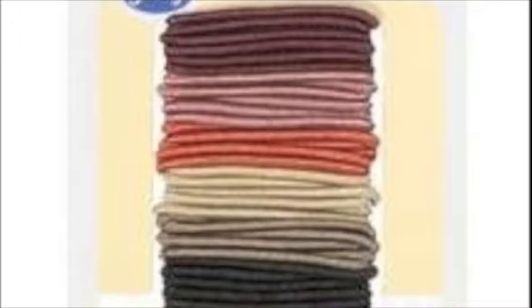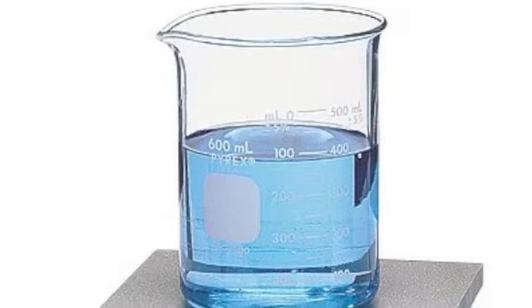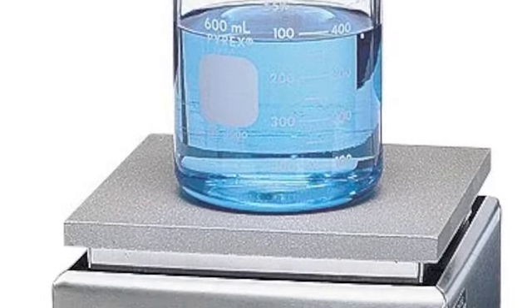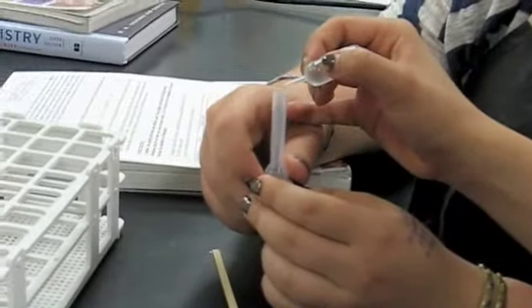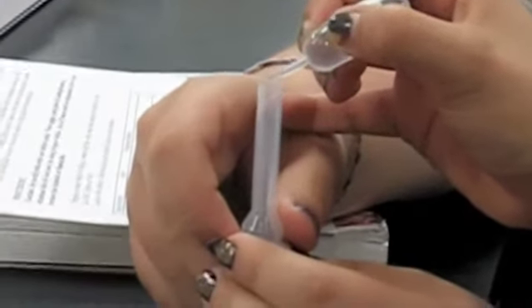You must also put your hair back in a ponytail. Your teacher will provide a beaker half full with water on top of a hot plate. You will have 2 opportunities to choose one acid and one alcohol that you will be combining to create different scents. You will put 10 drops of the alcohol and 2 to 3 drops of the acid.